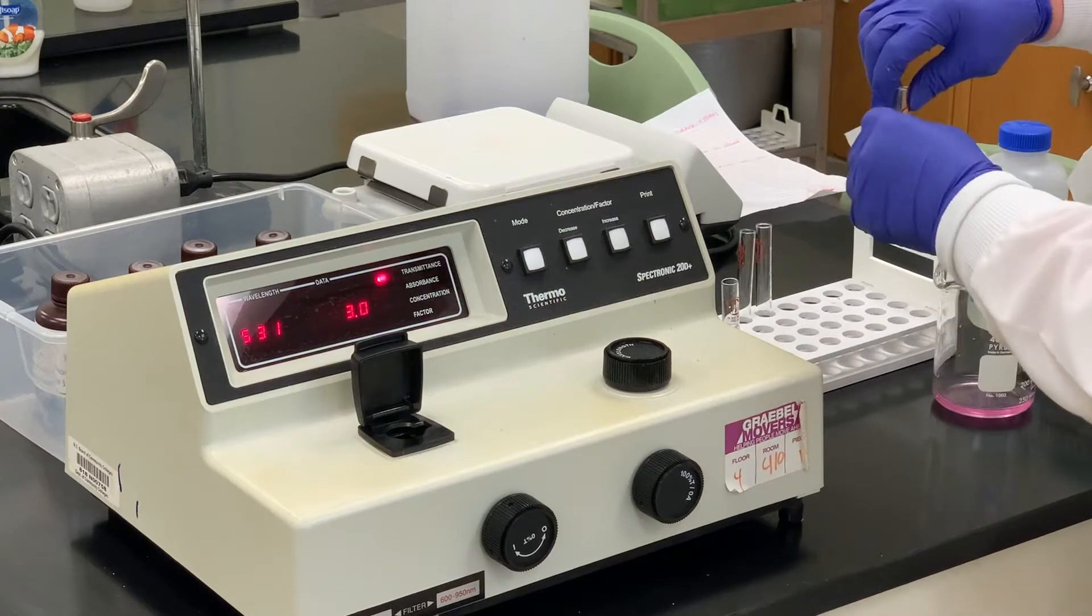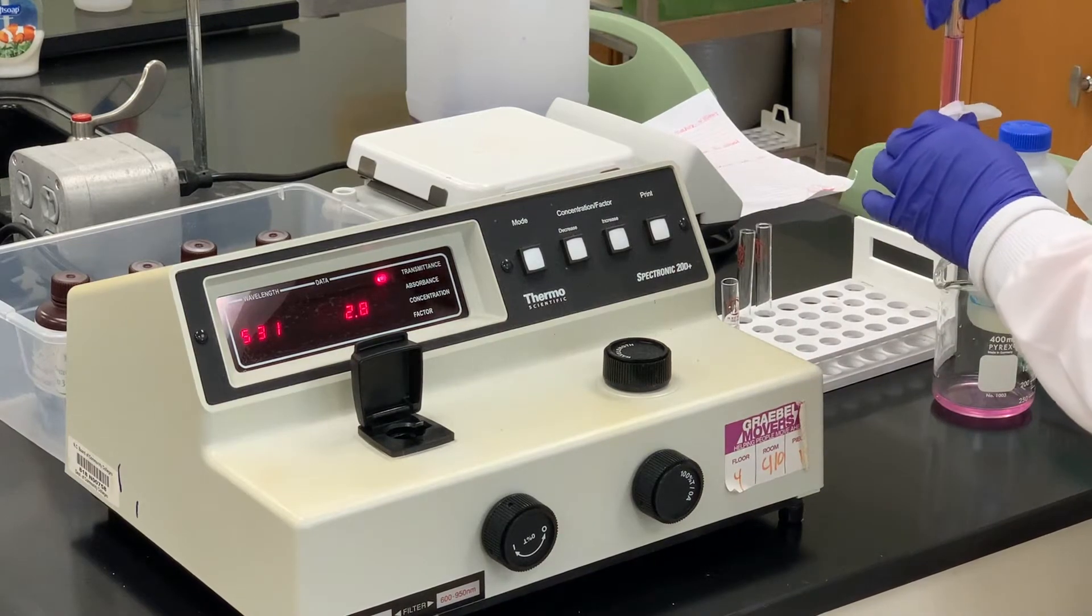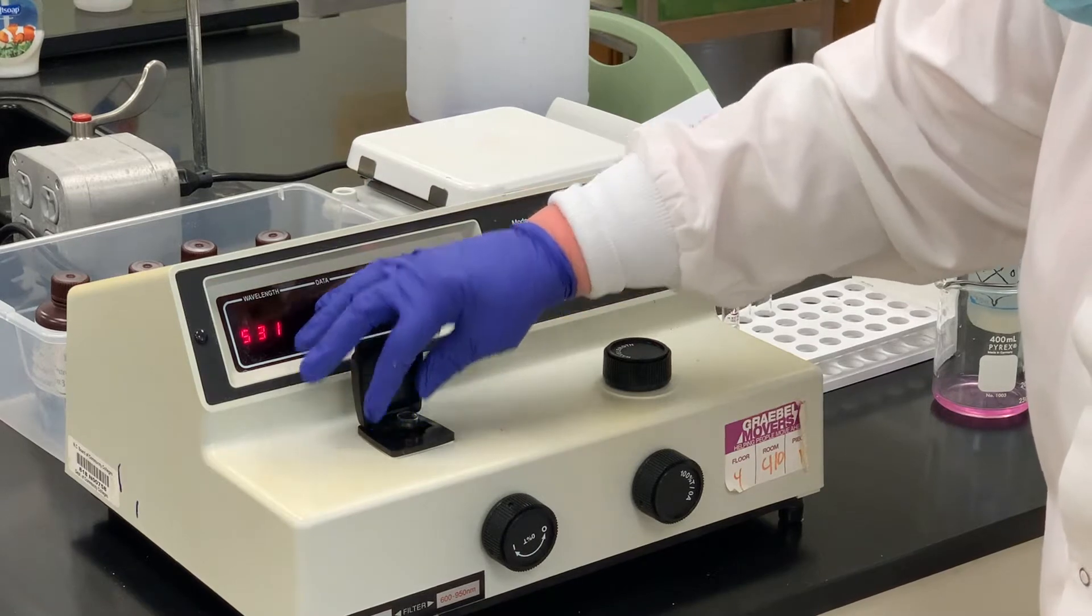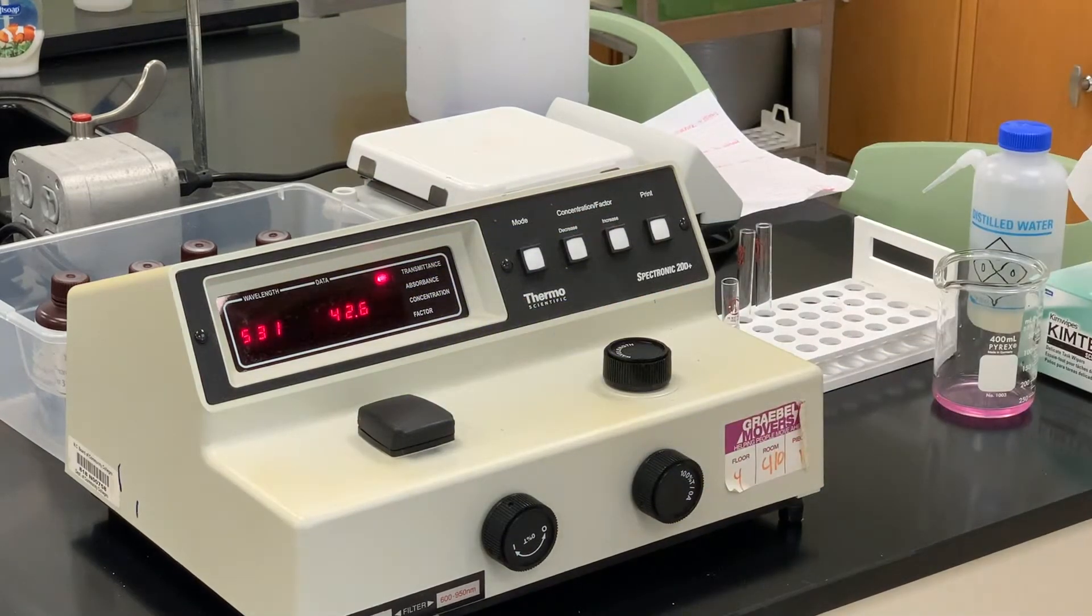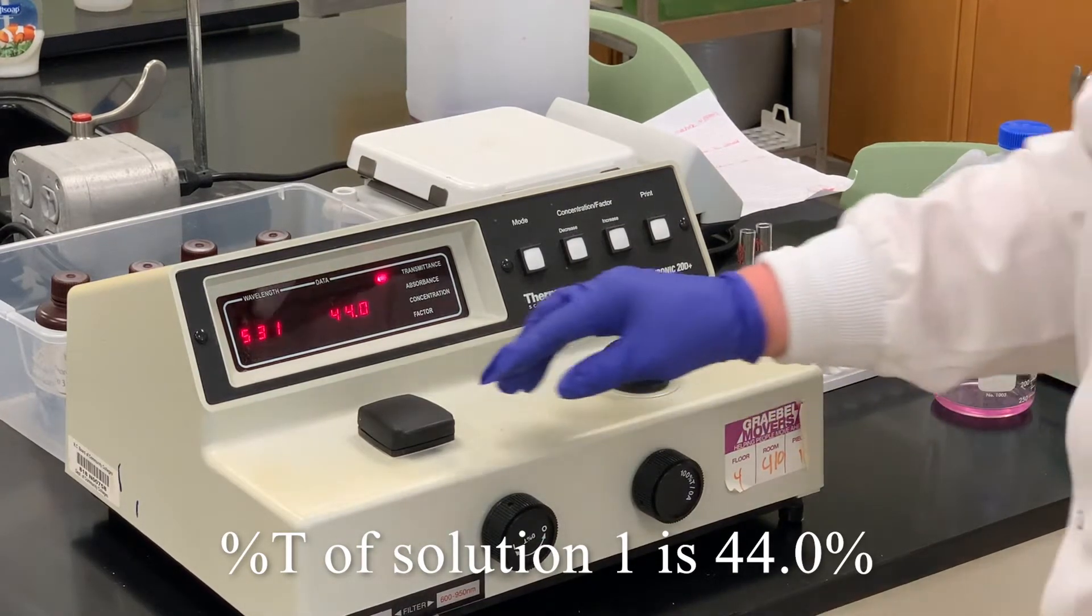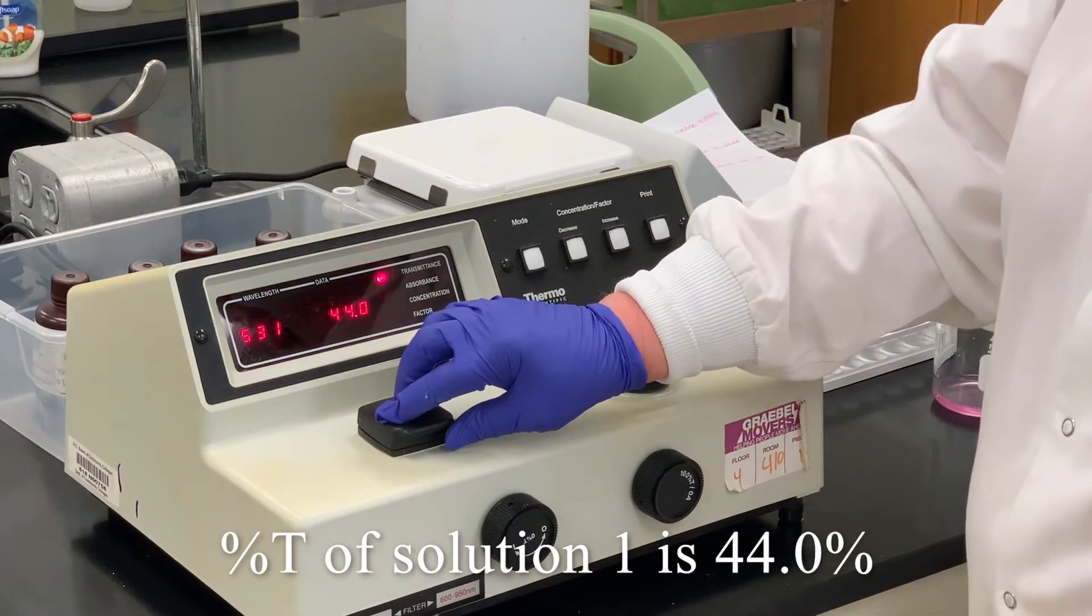So I'm going to re-test the first solution that was solution one and hopefully we'll get something similar that we did before. 44.0 which is not too bad from 43.6. Again that slight difference could just be variability in the machine. So 44.0 would be solution one.